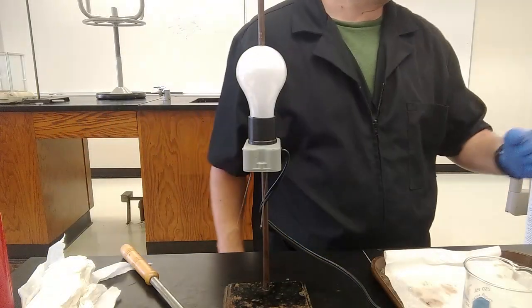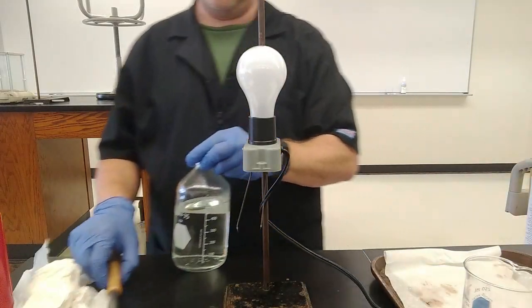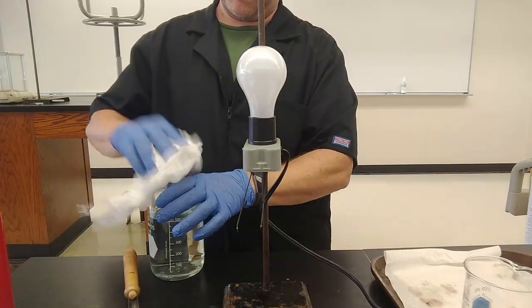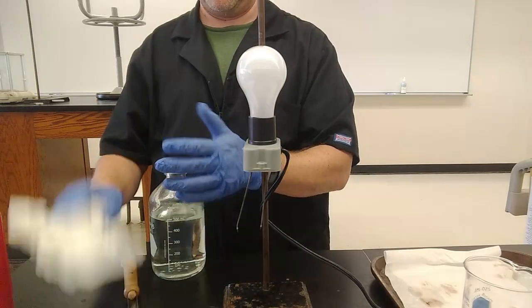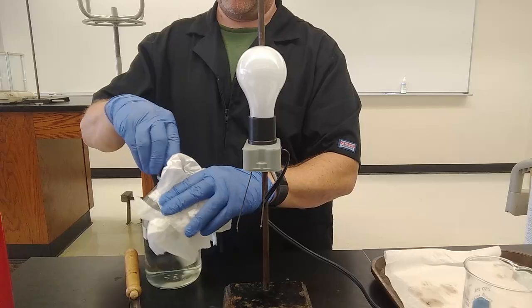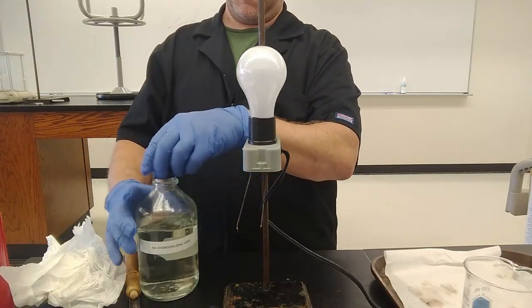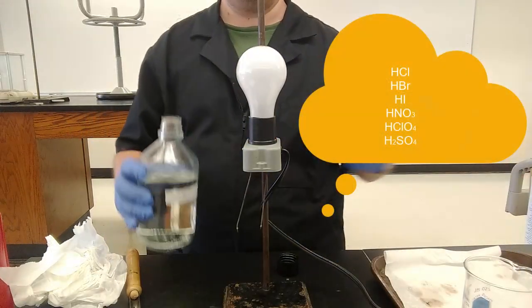Hydrochloric acid, also known as muriatic acid. If you ever owned or worked at a pool, there for some reason is a lot on this cap. Makes me a little bit nervous. Wipe off our bottle. Hydrochloric acid, you might recall, is on our list of 6 strong acids.